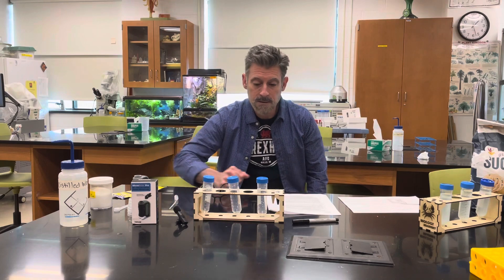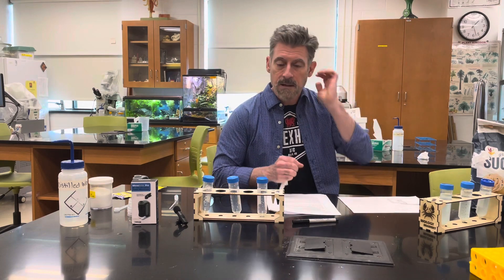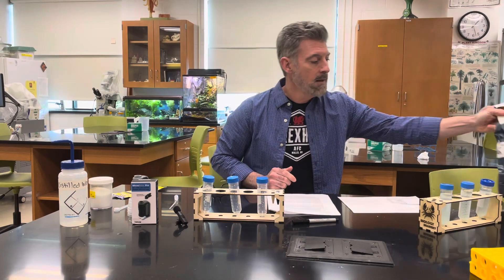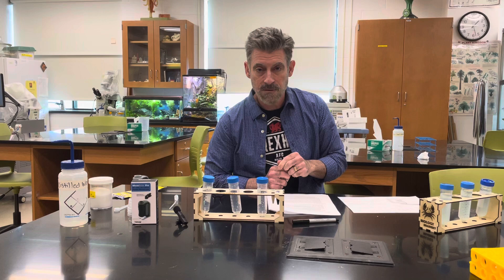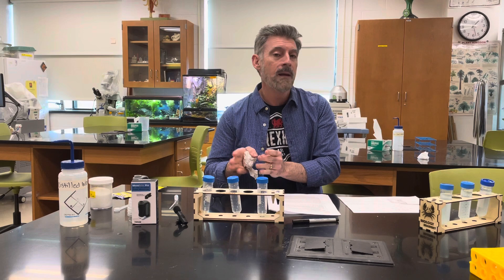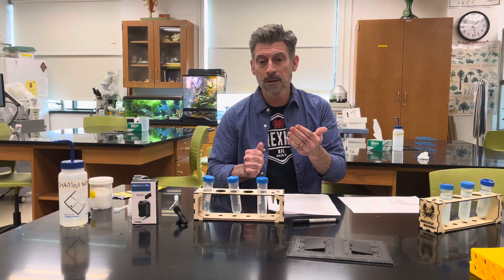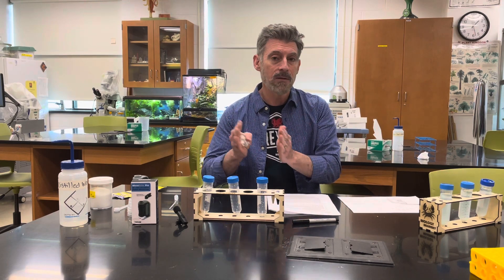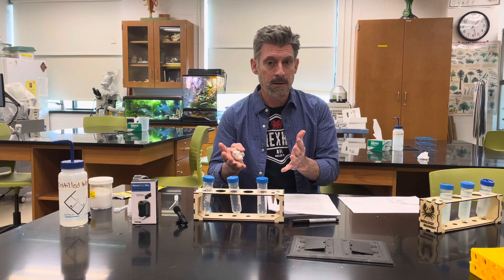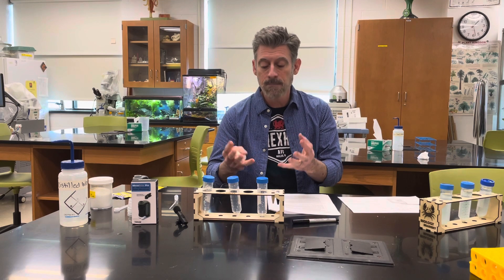Here are some of the setup instructions for the experiment you're going to do, which is the effect of sugar concentration. It is just regular sugar. The experiment is about the effect of sugar on yeast cell survival and replication — what we call growth — so cells dividing to become more cells. We're going to count living versus dead cells to find out if one treatment helps cells survive better than another, and also whether it speeds up their rate of cell division.